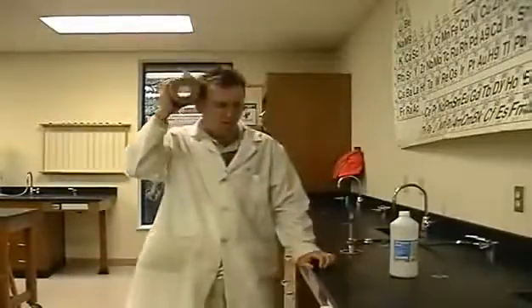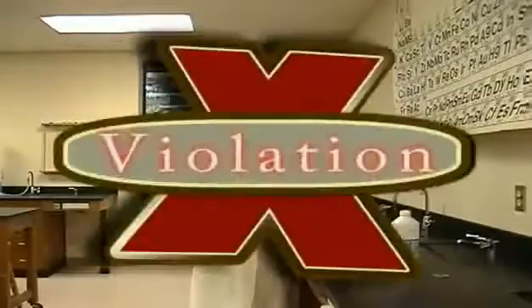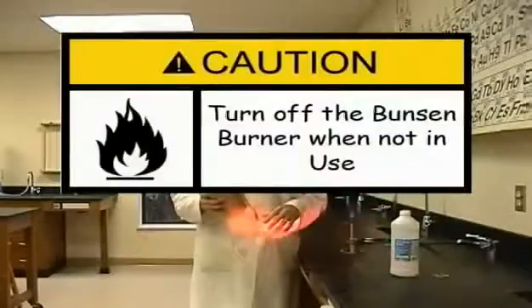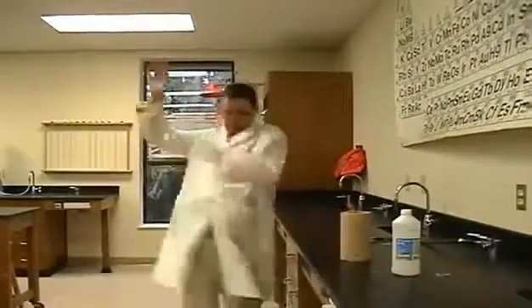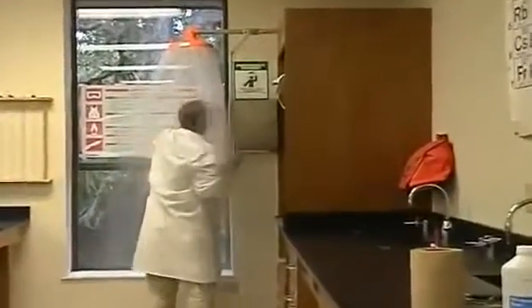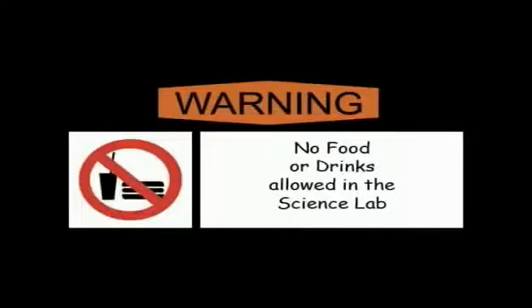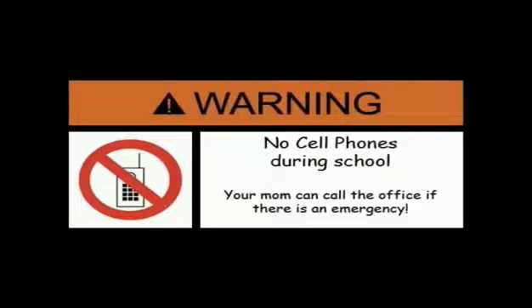Kids, when it comes to lab safety, it's very important to be aware. Violation! Always turn off the Bunsen burner when not in use. Do not recreate any of the stunts you have seen on TV in the lab or at home. No food or drinks allowed in the science lab. No cell phones allowed during school. Your mom can call the office if there's an emergency.